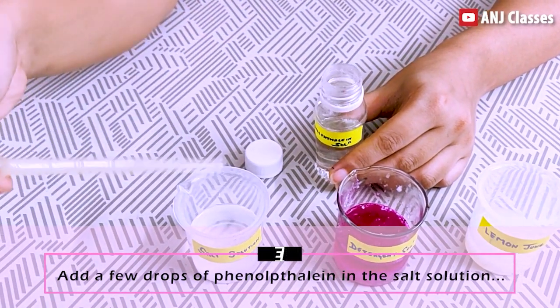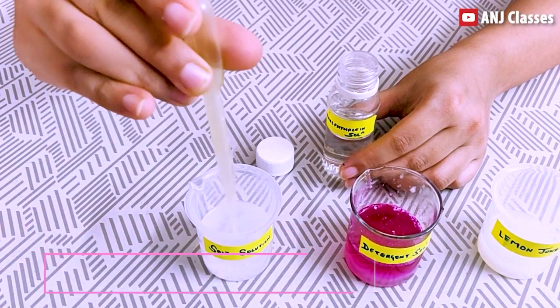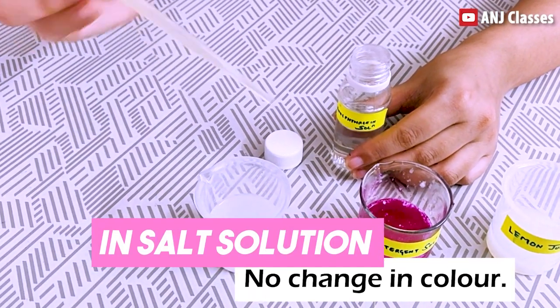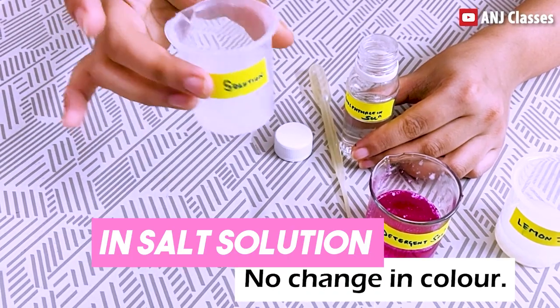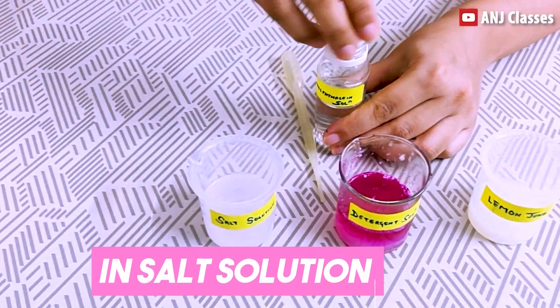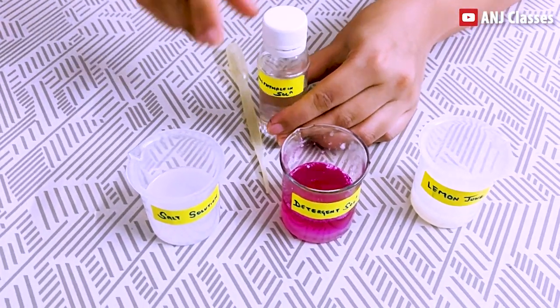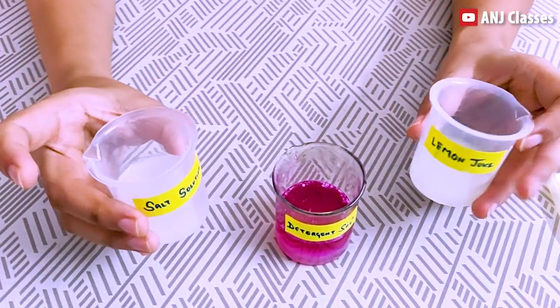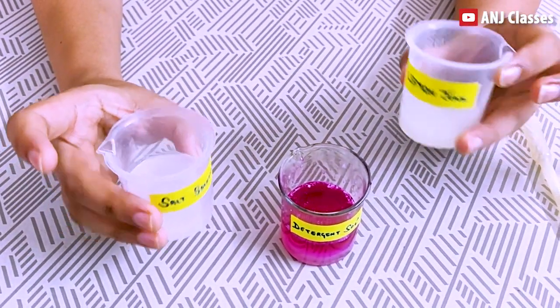Now I will add few drops of phenolphthalein solution to my neutral solution, that is salt solution. Again, you can see there is no change in color.